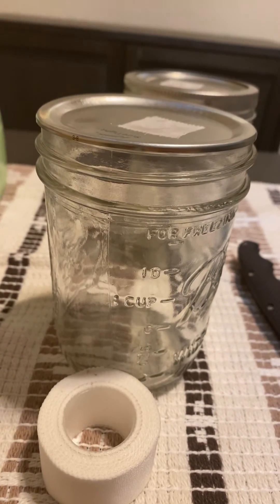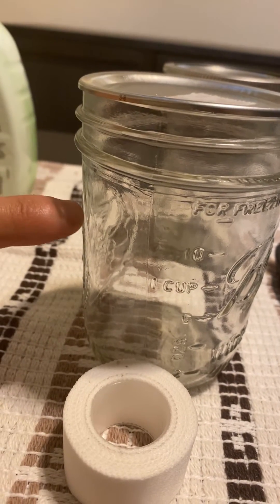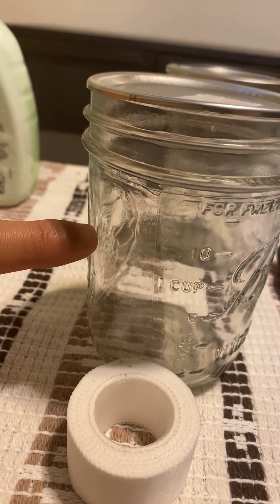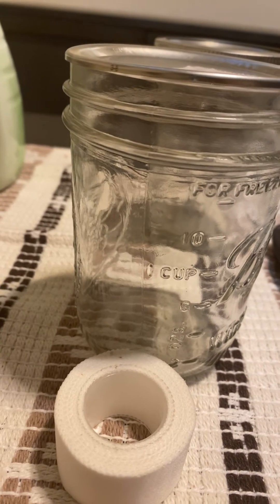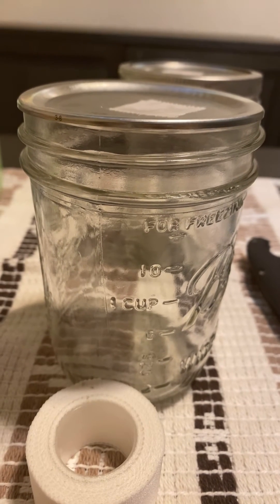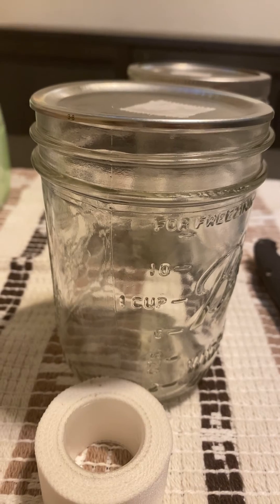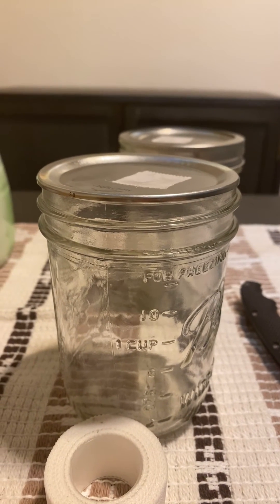Very simple. I don't even load it up that high — I load it up to like right here. And then I just put a bunch of agar wedges inside of it. Not too big of an agar wedge, but enough to really get it popping off within a week's time. By the end of that week, it should reach full colonization. From there, we would move them into a larger quart-sized jar filled with whole oats and just watch her go.